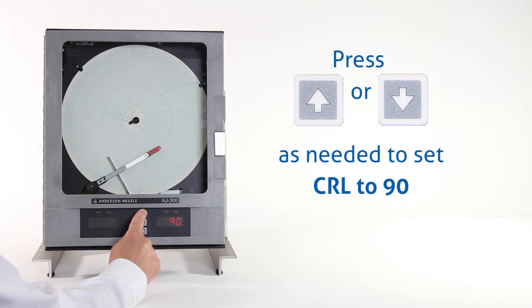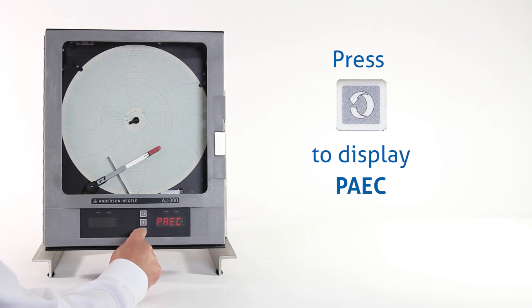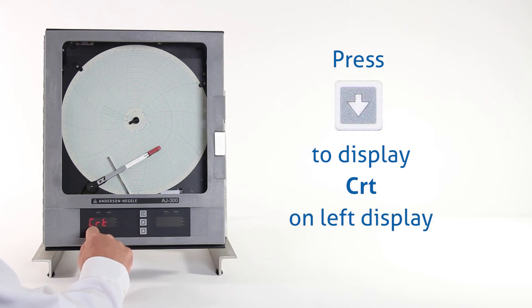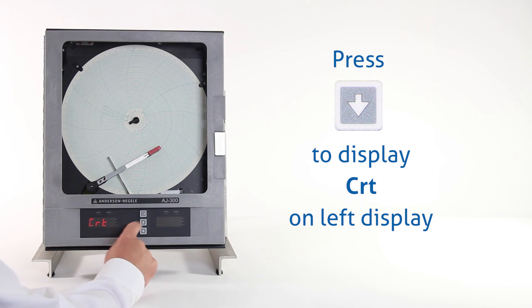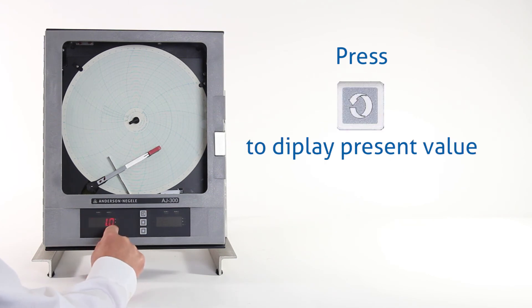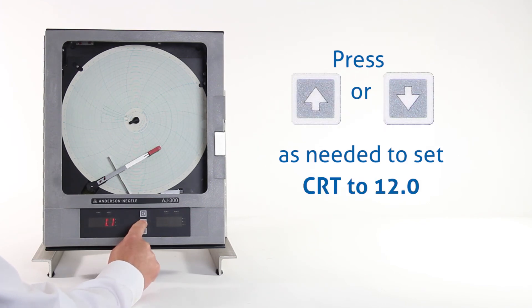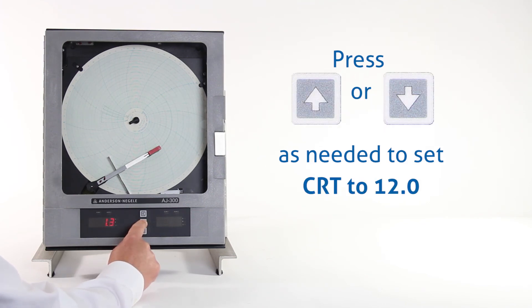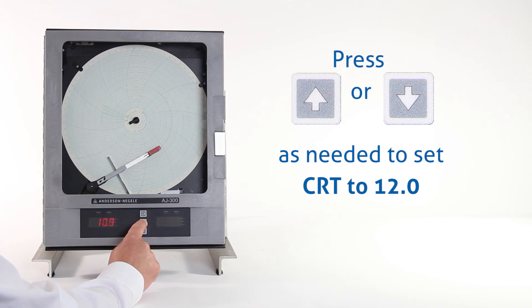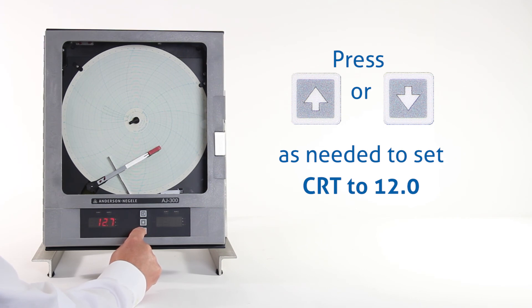Once we're at 90, we press the scroll key. We have PAEC. Now we're going to hit the down arrow key to go over to the left-hand display — we see CRT, that's for chart rotation time. With CRT, we press the scroll key and we see a value of 1.0. We want 12.0 because we're running a 12-hour chart. We can press and hold the up arrow key — the longer we hold it, the faster it goes. If you go past it, use the down arrow key to correct.